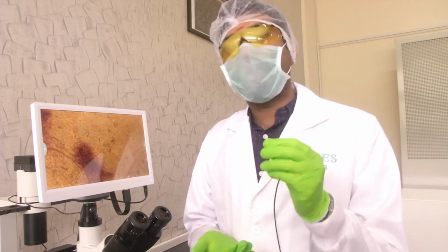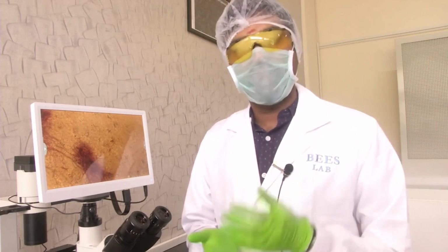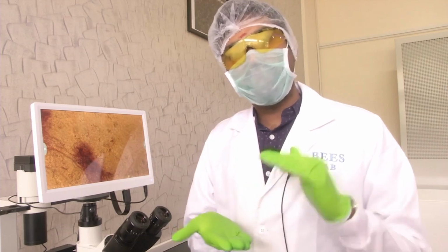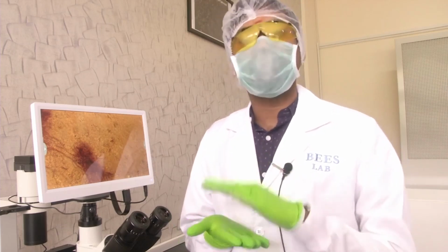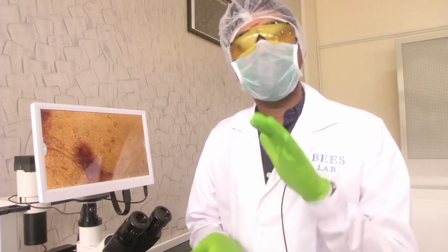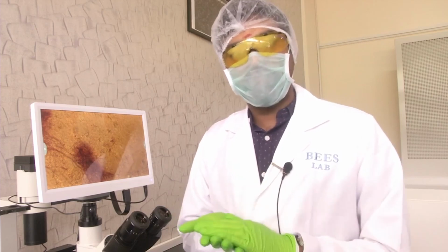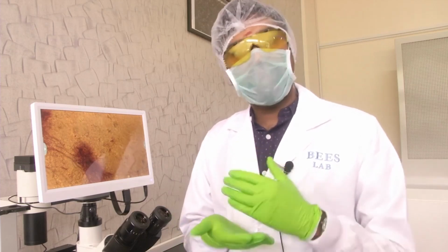If you look into biology a bit more closely, if you grow cells in a dish, the cells will go and attach on the bottom of the dish. This is their inherent property. It is called cell attachment and matrix formation. So cells will go and attach to the bottom of the dish and stay there.